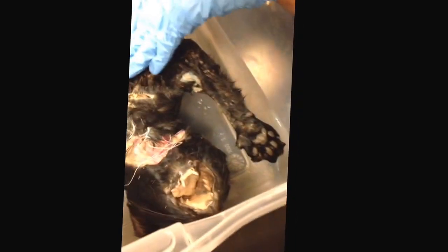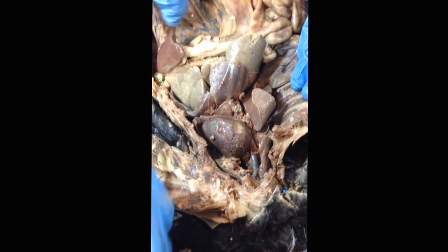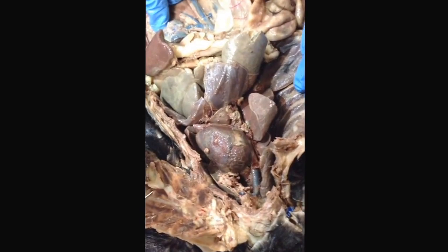Next thing on the list is the thymus, and for this one, it's not really to worry about this because on the dissection process, the flap of tissue covering the heart is usually removed, but the thymus is a flap of tissue on the heart. Next thing on the list is the kidney. No explanation needed there. Next thing is the left ventricle.